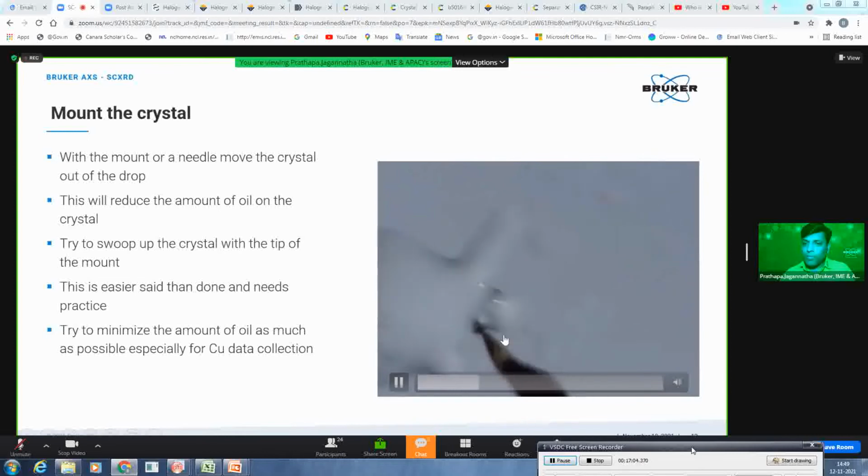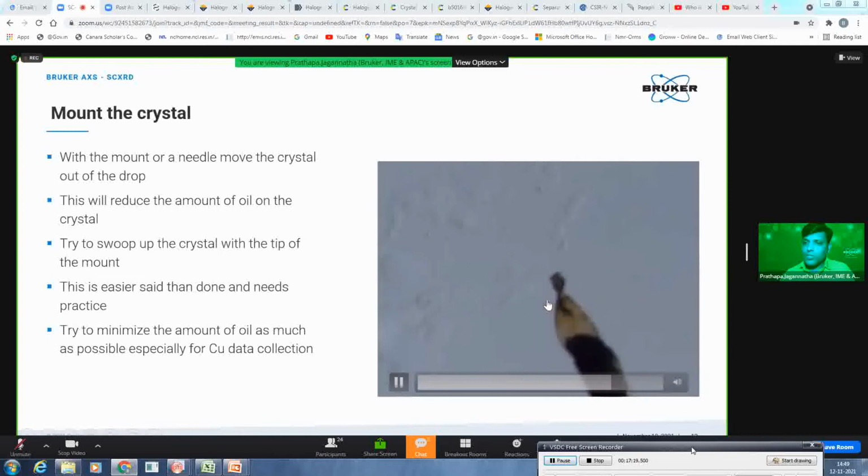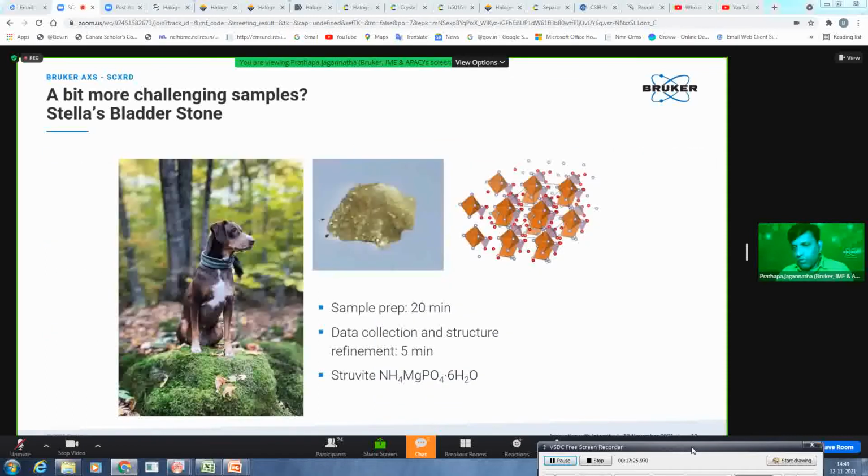The aim is to mount the crystal with a minimum amount of oil. He doesn't want to mount a crystal with a lot of oil, which will give a lot of background. While doing so, he also picked up the crystal, so he's happy, and he is going to the diffractometer for the mounting. So before he goes to the diffractometer, I want to stress with a couple of slides the impact of your sample preparation.